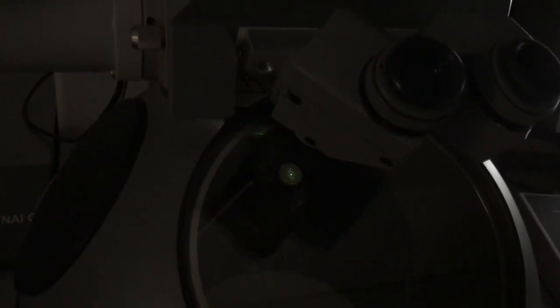What I have to do now is adjust the C2 lens to make sure the beam is parallel. The way you tell that is to look at how sharp the spots are. If the spots are as small as possible, focused, then you have a parallel beam. Right now it's actually pretty close. I'm adjusting the C2, which is the intensity knob here on my left-hand panel.